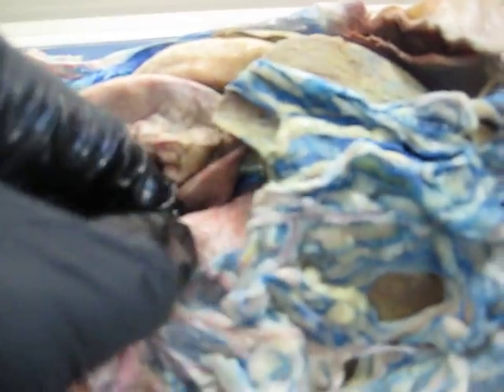In this case it's a light pink. I'm sorry if it's out of focus, but the pancreas is located dorsally of the stomach, and it is a bit firmer than the very soft fatty portion of the greater omentum, so it is this area right here.